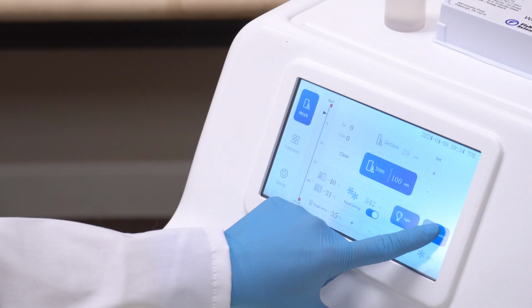UV lamp icon. This icon controls the UV disinfection lamp. It's important to note that UV disinfection should only be activated when the glass door is closed. If the door is open, the UV lamp cannot be operated for safety reasons. When the UV lamp is on and you open the glass door, it will automatically turn off as a safety precaution. Closing the door will reactivate the UV lamp.